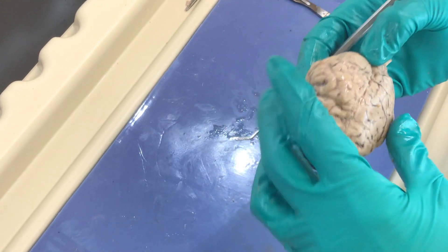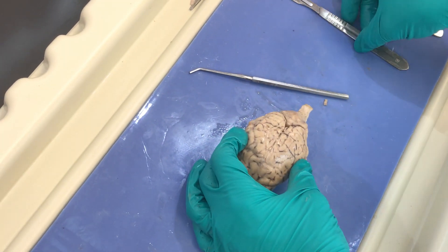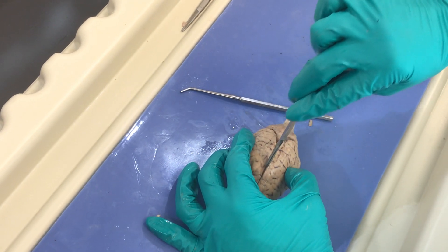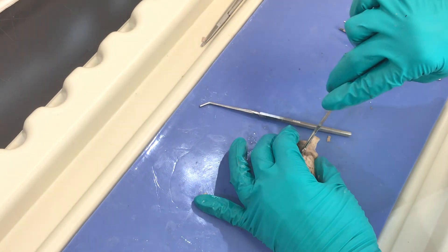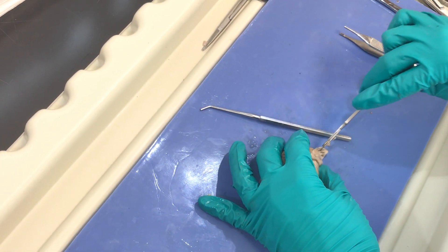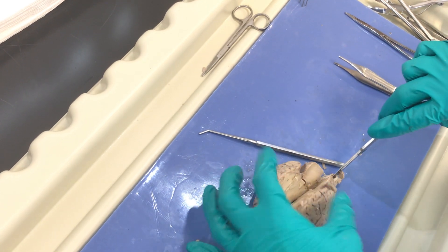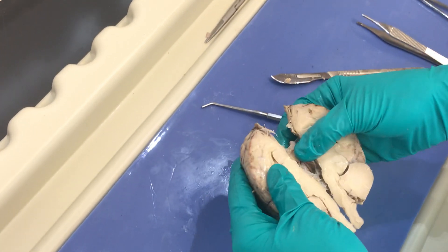To look at the inside of the brain, we're going to make a sagittal section — we're going to extend right down the midline, right down our longitudinal fissure, and try to go as evenly as possible straight through the cerebellum and through the spinal cord. By transecting the brain we're now going to be able to look at the hemispheres.